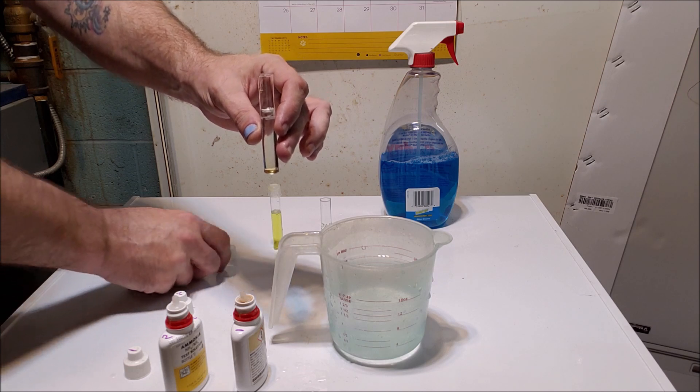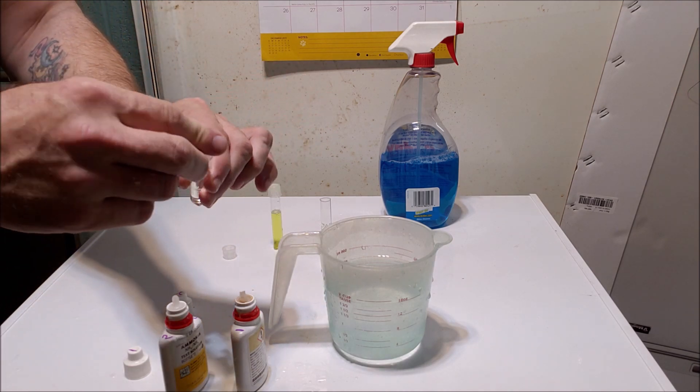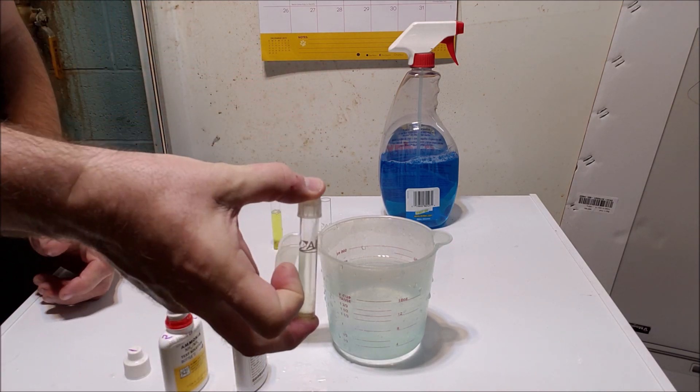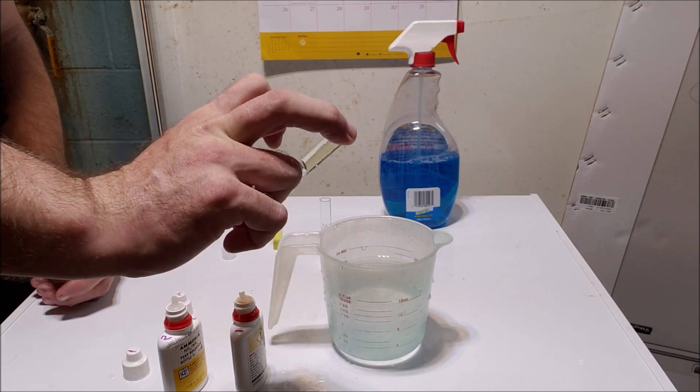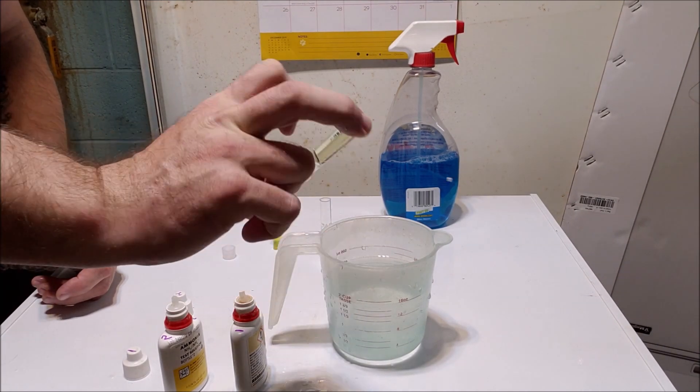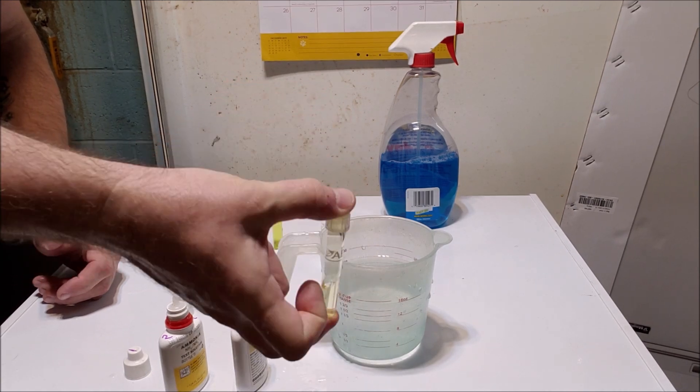So there's eight of one, eight of two, all at the same time. And now I don't actually bother shaking it. I just rock it back and forth ten times, fifteen times, make sure that's all mixed up.